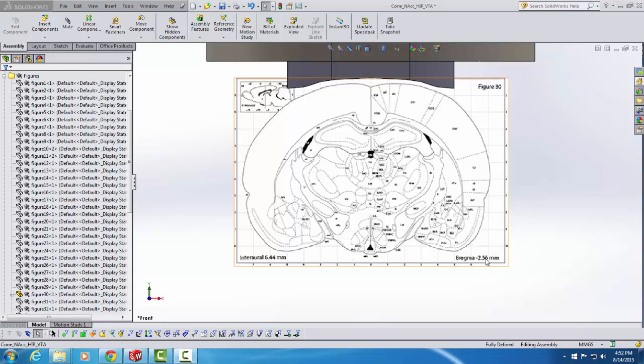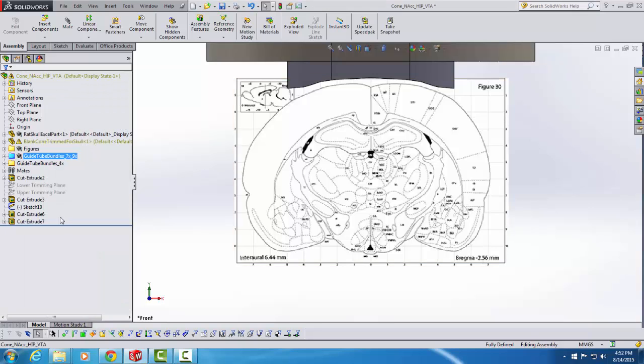Now that my target plane is visible, I'm going to go over here and collapse the Figures folder so that I can see all of the components of the template file again. And now I want to draw your attention to these two Guide Tube Bundle folders. There are three different types of Guide Tube bundles that we can use with this template file: 9x, 7x, and 4x bundles, and we'll see what that means in just a moment.